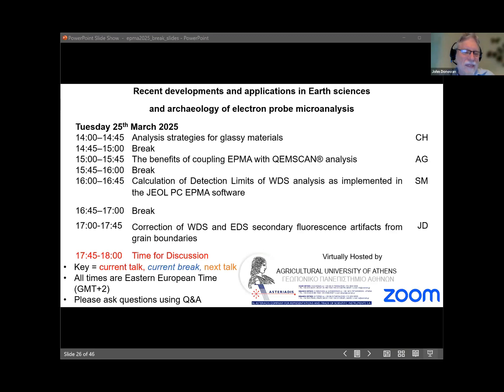To answer your other question, Steve, I actually forgot to mention one thing: in this PenFluor version of PenEPMA, you don't have to calculate each distance. Once you calculate the par files, the parameter files for a given material, it calculates all these points in seconds. It does assume a point source for fluorescence, which is not super accurate when you're really close to the boundary, but if you get more than 5-10 microns away, it's pretty accurate. So you can get all these within a few seconds. If you're running the original PenEPMA software, yes, you have to calculate each distance from the K ratios, the intensities from each point from the boundary.